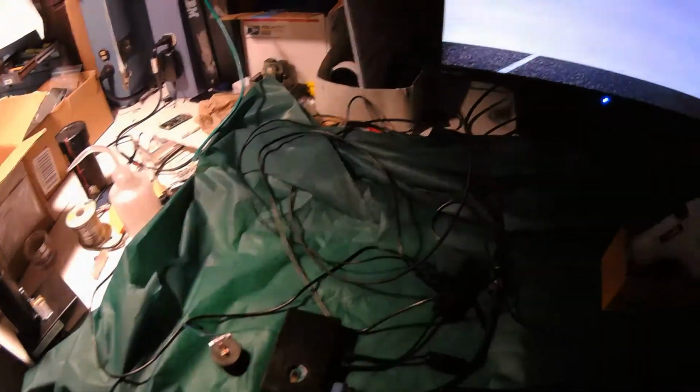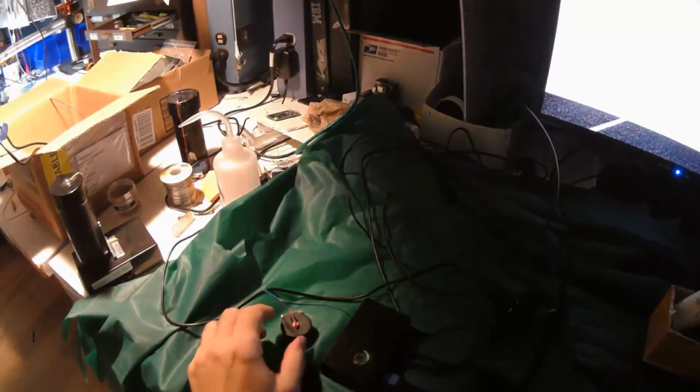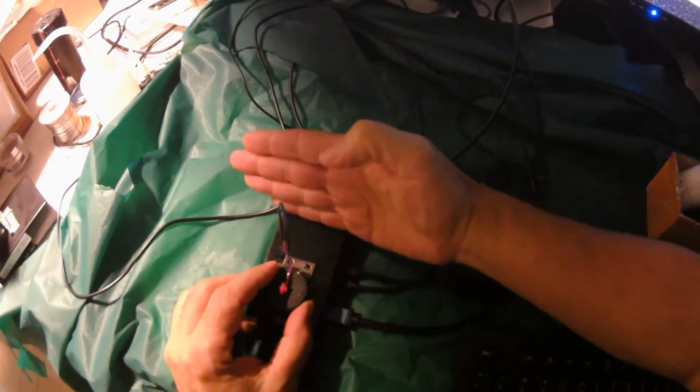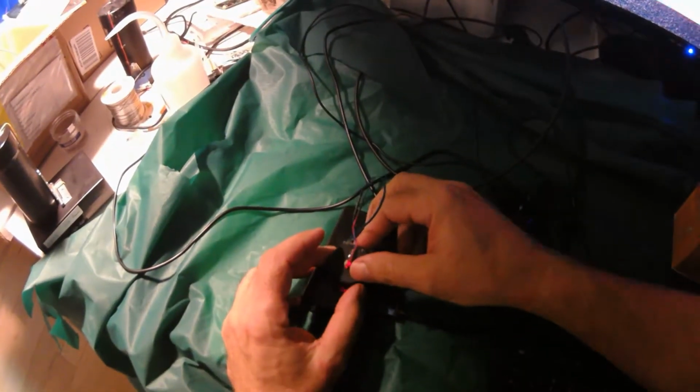That's good. So I'm going to dim this down a little. If I cover it completely, it's black. That's a good sign. No light's leaking anywhere. Okay, so now if we put the laser on top, we're going to align it so the edge of the hinge is parallel to the edge of the case, and now we're going to slide it back and forth, and you can see.